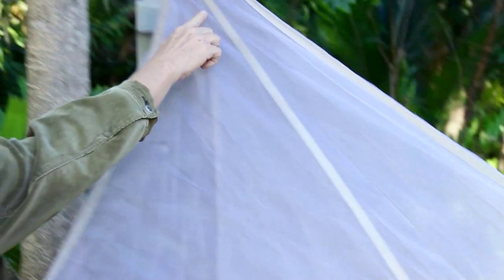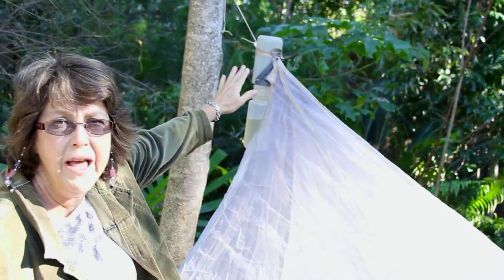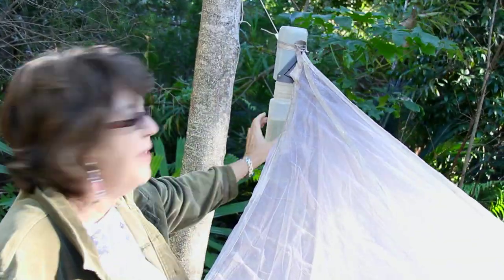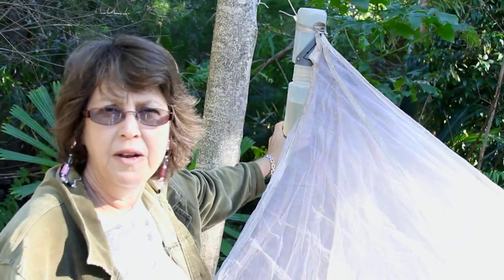They come up to the top and they continue to move up to what we call the head. They go into this chamber at the top and then they fall into the preservative that's underneath in the collection chamber.